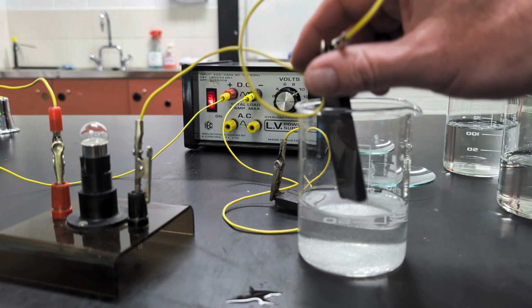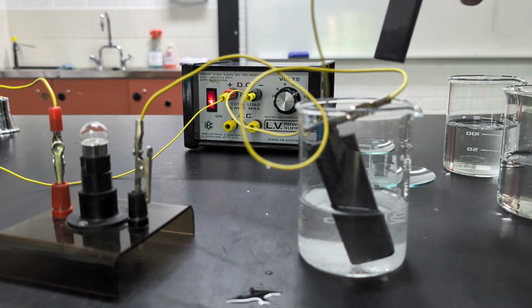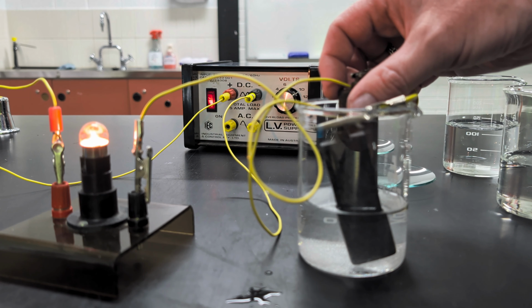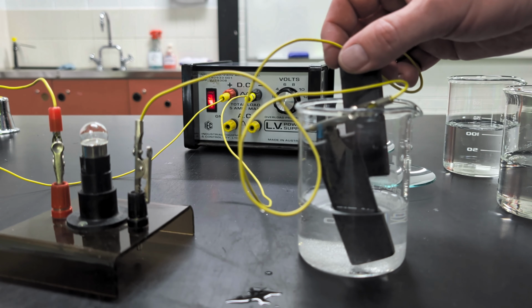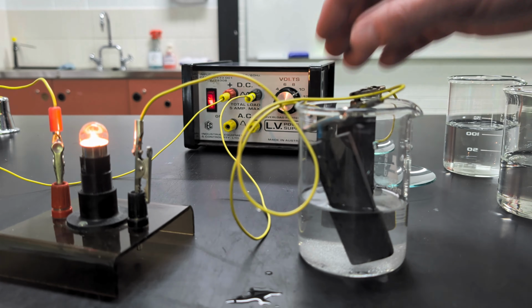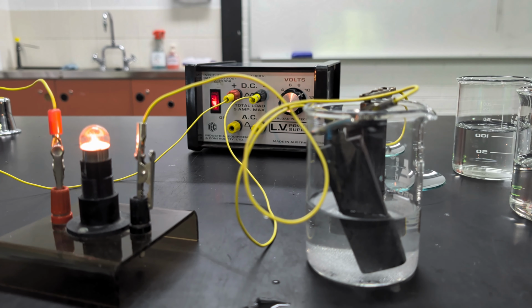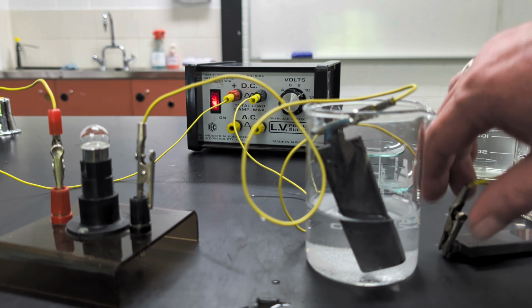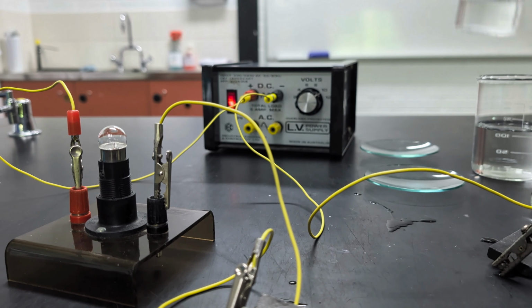Let's just drop one electrode in, and then we'll put the other electrode in. Remember, as a solid compound, this did not conduct current, but now it does. You'll note actually not as bright as if I touch the electrodes together, brighter, but the salty solution definitely does conduct current. That lamp really is glowing. Let's try one of the other compounds we have. Put that salty water aside.